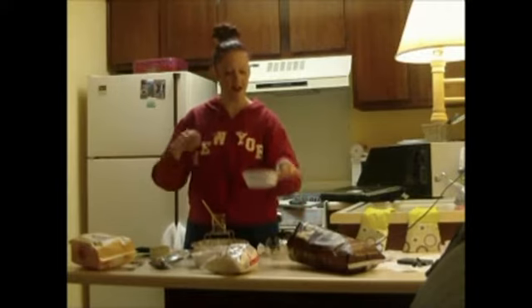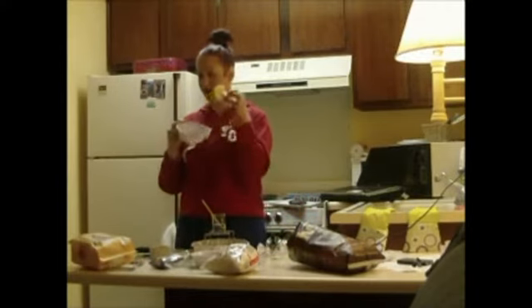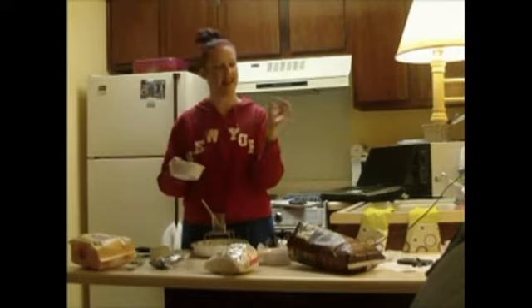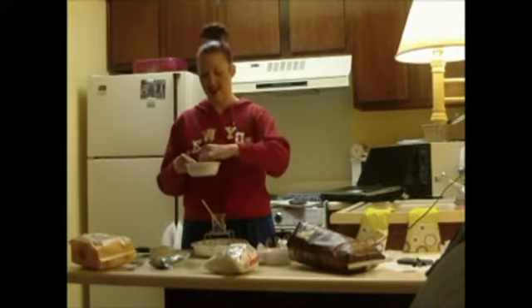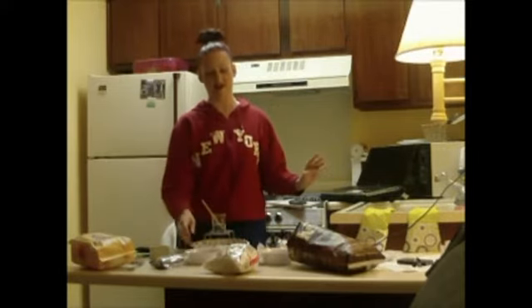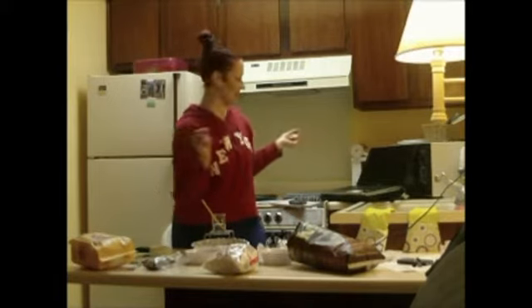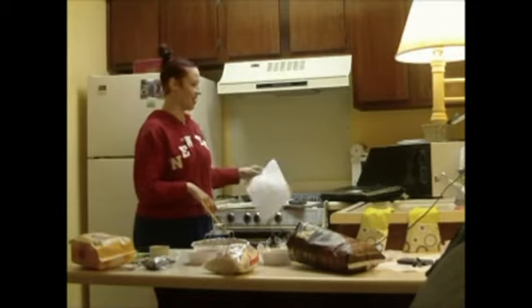And I already did some calculations where I set aside this particular potato chip that I'm going to be using. And this walnut is really big and should be pretty awesome. And then this marshmallow here, now I'm starting to wish that I had gotten jumbo marshmallows, the kind that you make s'mores out of. But anyways, basically with this lab, let me explain what we're doing today.